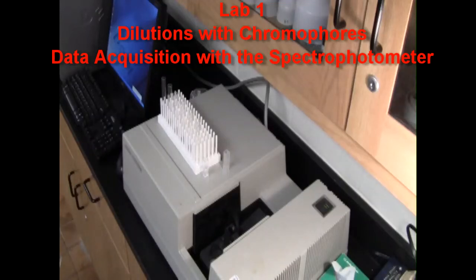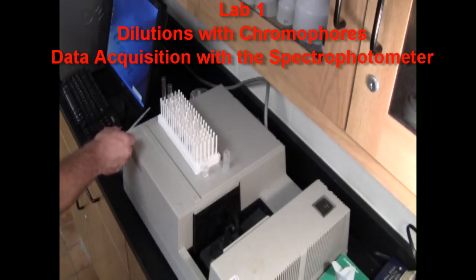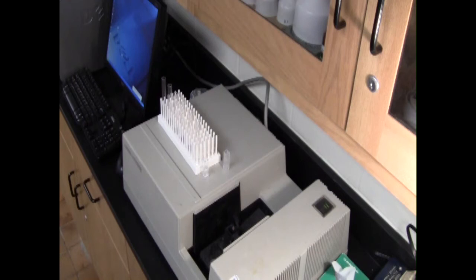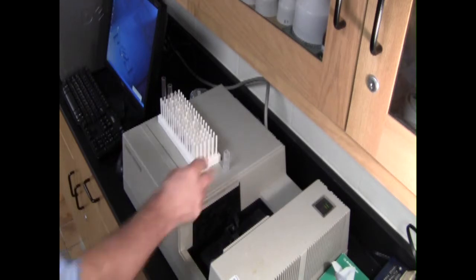After you've made your dilutions, you'll be able to see your stock solution being diluted down. This is just buffer. So you see the color dissipate. When you record the absorbances, you want to start from your lightest to your darkest.